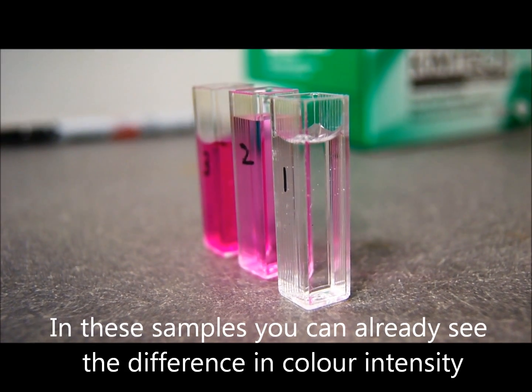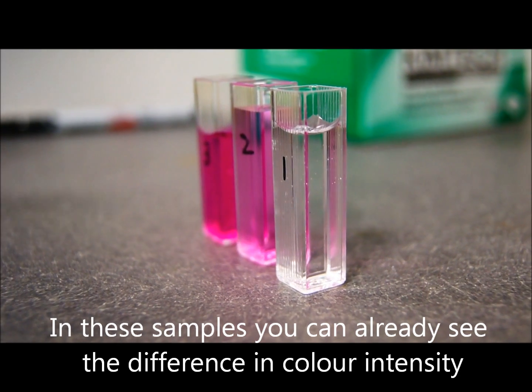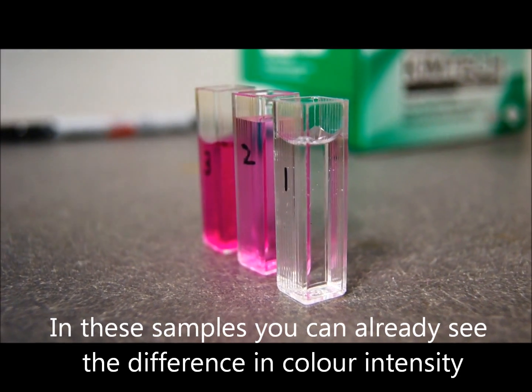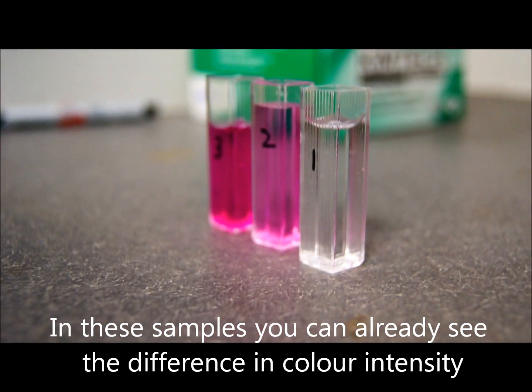Here we have the three cuvettes. This is just a sample. You can see the relative color intensity from cuvette 1 to 3.